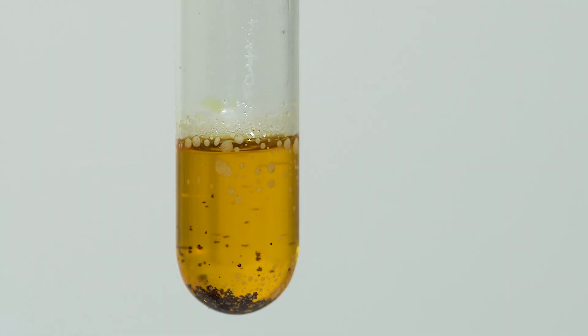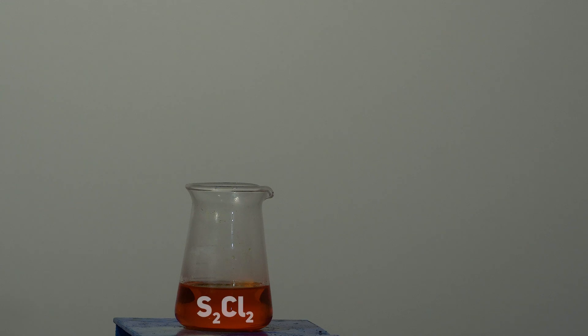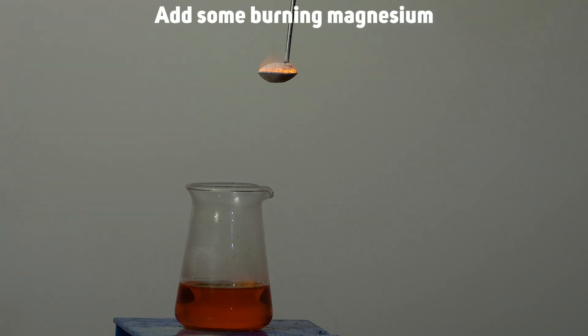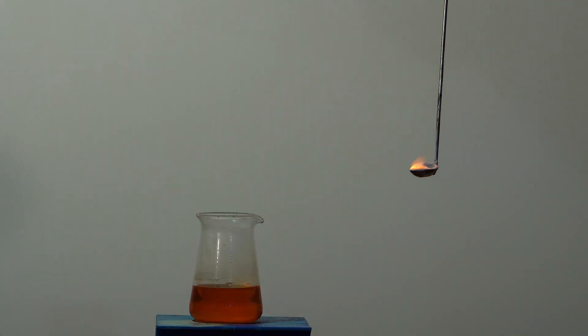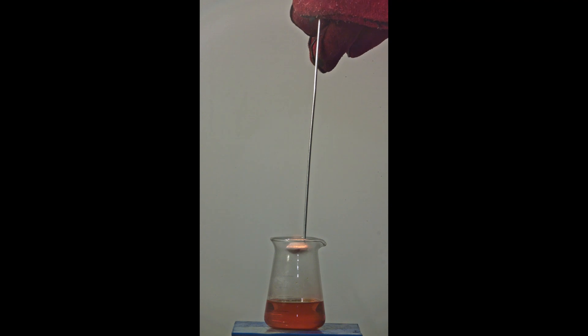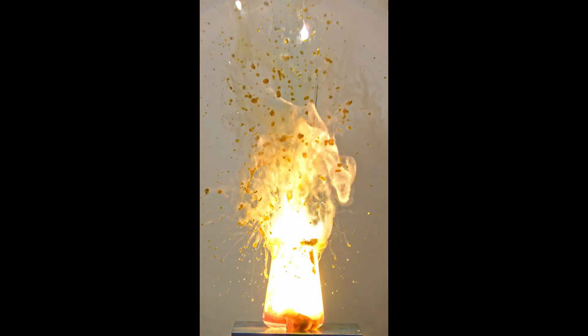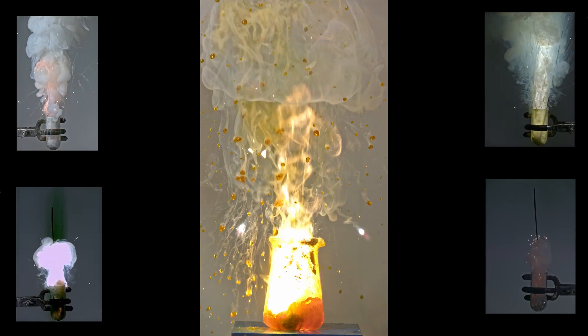When heated, disulfur dichloride easily dissolves red phosphorus. But this is what will happen if I put burning magnesium into this liquid. I've already carried out this reaction with many other liquid and organic chlorides, and this reaction will also go into the collection.